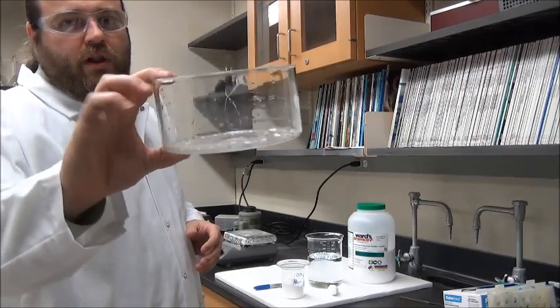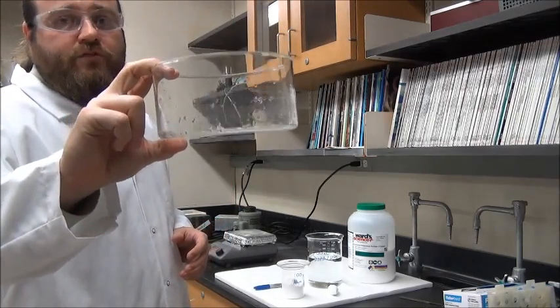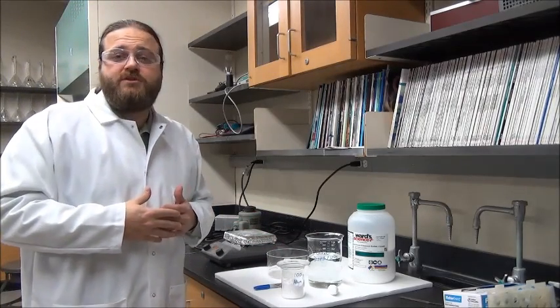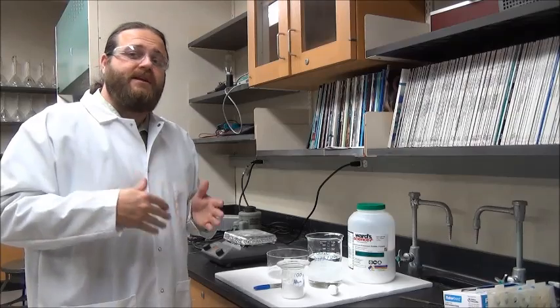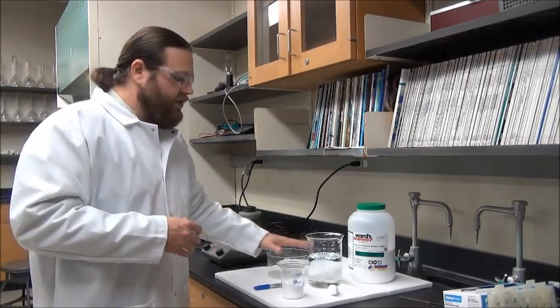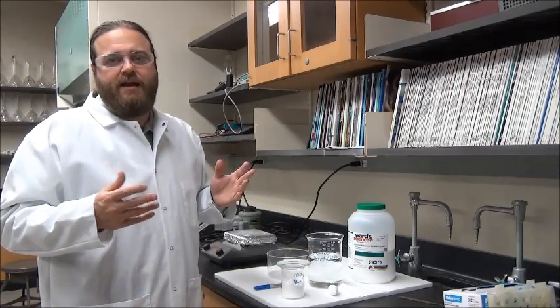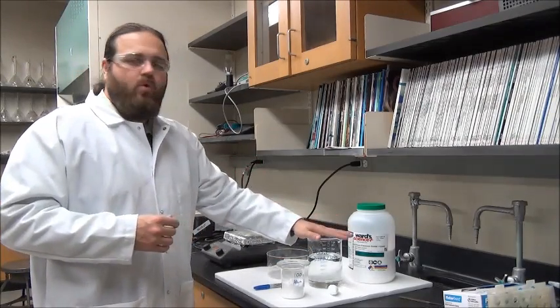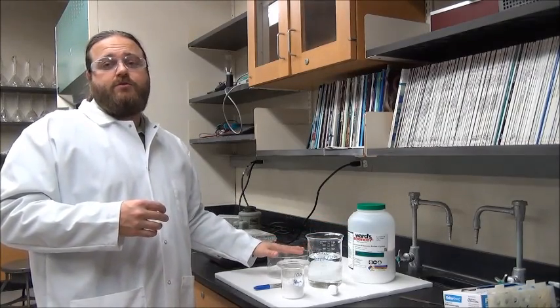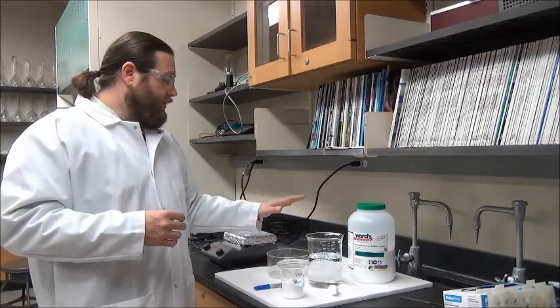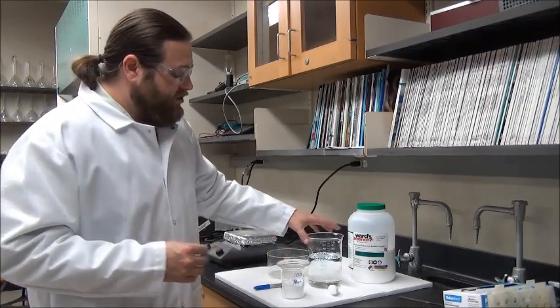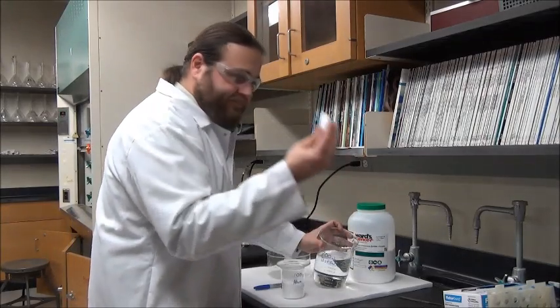The final thing I have here is a glass crystallization dish. You'll want to find some sort of vessel that you'll pour your warm crystallization solution into and set it aside so that you can begin to grow nice seed crystals. You don't need one of these dishes, just any kind of container which will hold this volume of water. For the crystallization part, you can use canning jars or really just about anything.